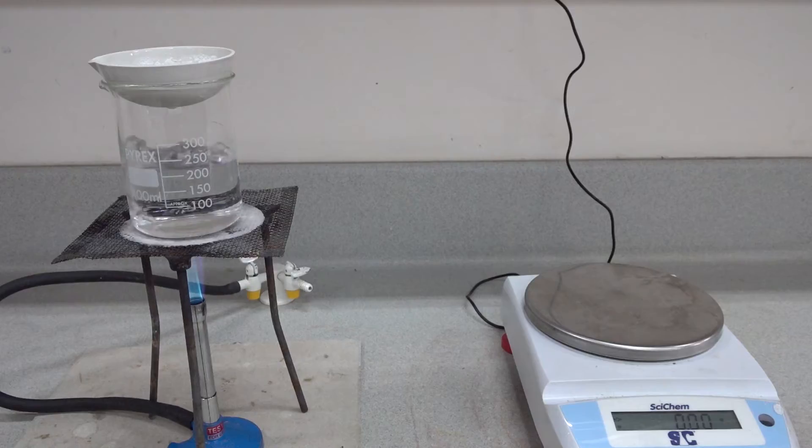In the evaporating basin we have placed a concentrated, indeed saturated solution of potassium nitrate.